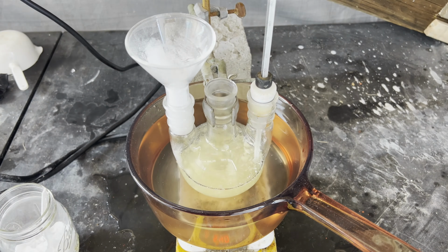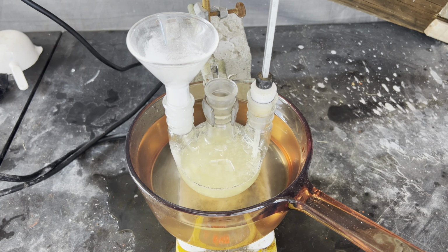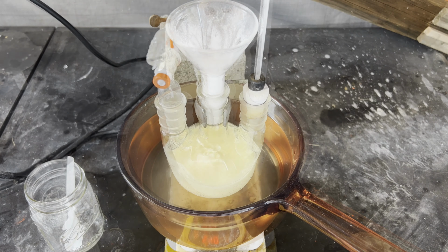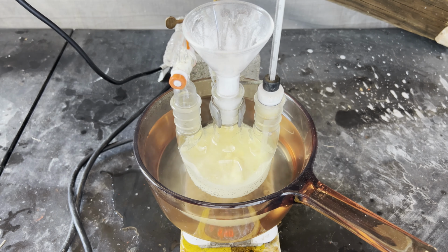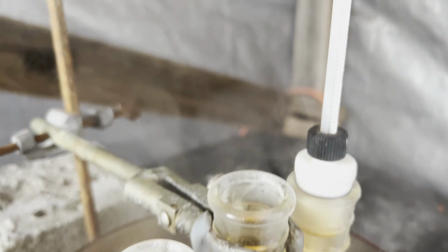The benzoic acid and potassium nitrate are powdered and thoroughly combined with a mortar and pestle. This mixture is gradually added to the sulfuric acid while stirring. I add it at such a rate that the temperature stays around 50 to 60 degrees. Once all of it's added, I crank the heat up on the hot plate, but the water doesn't get hot enough for the mixture to become clear, so I move it to a heating mantle.